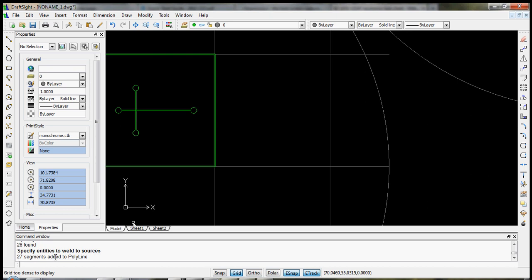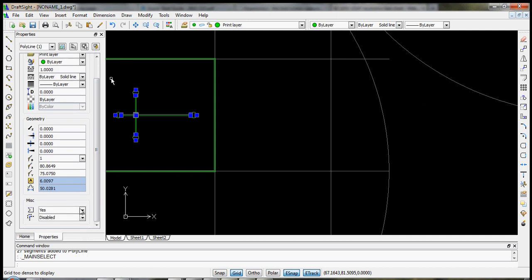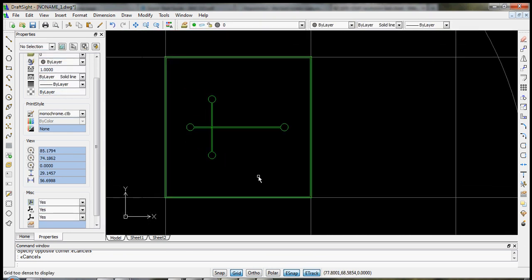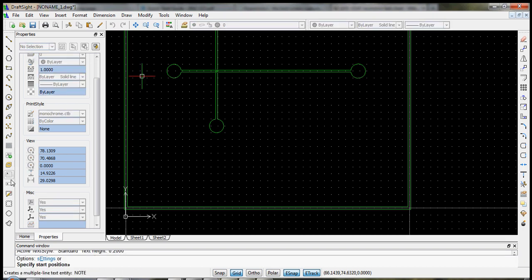Now it says 27 segments added to the polyline. So click on it, we see now there's only one polyline, and it is closed. So we're good. We have a single unit. This should now print nicely. We have potentially a microfluidic droplet generator. Now the last thing we should do is give this a label. We always want to put our name and some descriptive feature so that we know when this was made and what the features are.